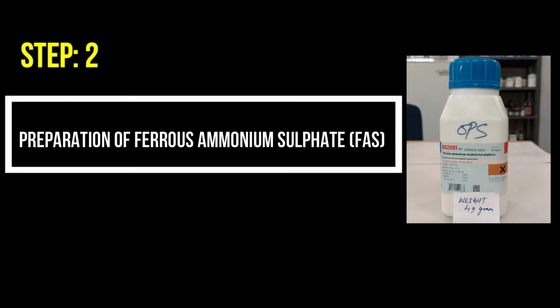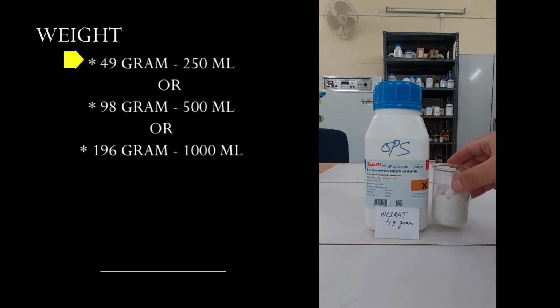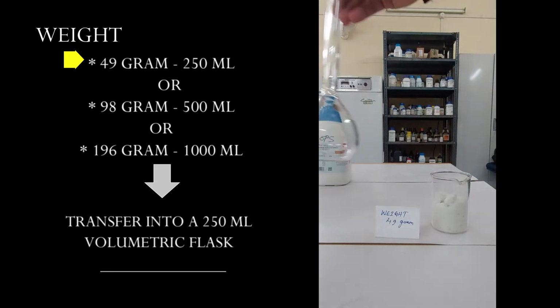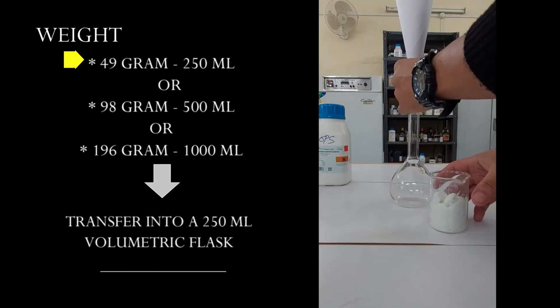For this, again, depending on how many samples you have, accordingly you prepare. Okay. So for this demonstration purpose, I'm going to use the least amount of chemicals. So I'm going to weigh 49 grams of ferrous ammonium sulfate or FAS. This is 49 gram of ferrous ammonium sulfate, and then I'll transfer it into a 250 ml flask.